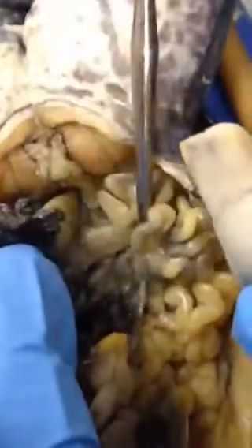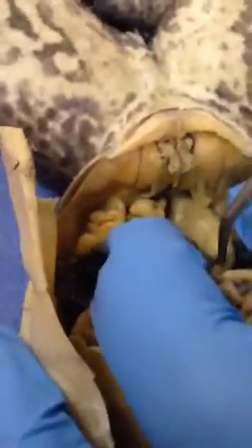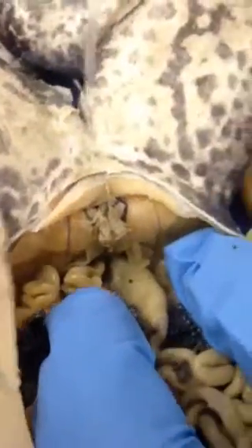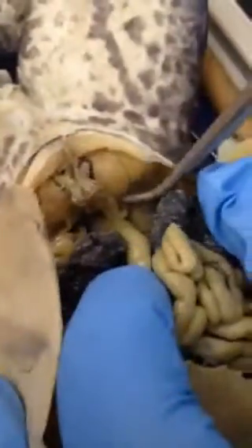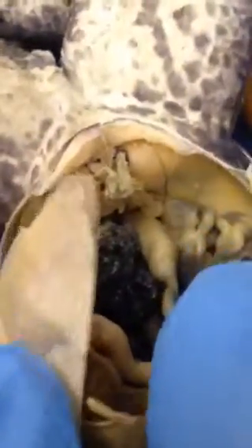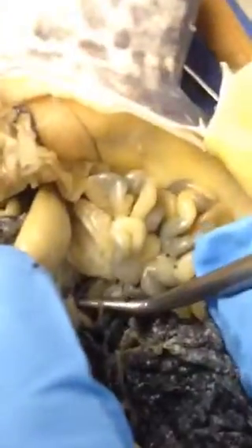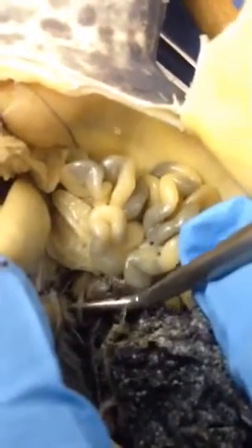And then the other one is on the other side — let's see if I can get to it. Right there, perfect. The small intestine continues and connects right here to the large intestine, which is this little short thick thing. That leads to a cloaca, but we don't need that. This membrane-looking thing right here is the urinary bladder. This tube is the ureter.